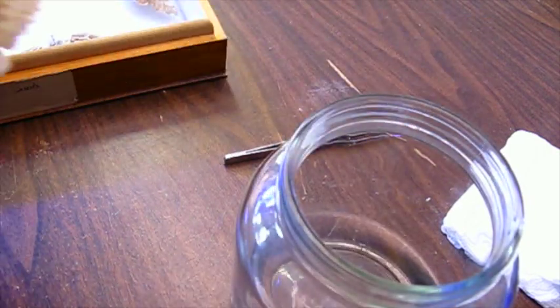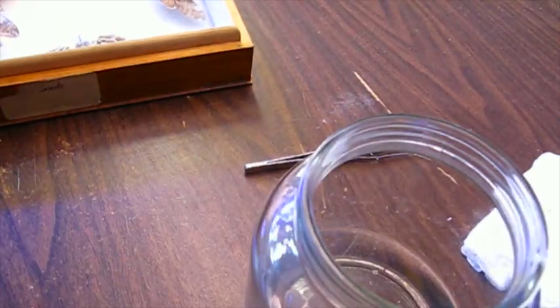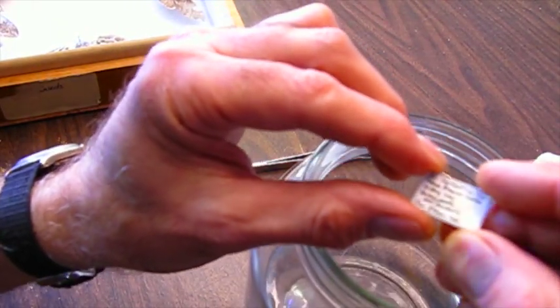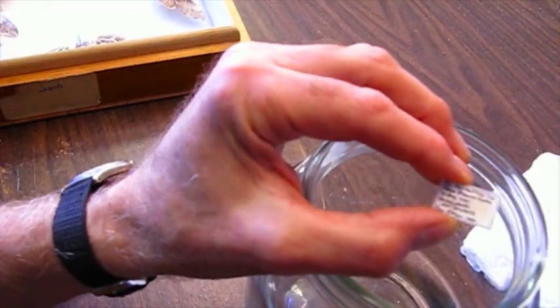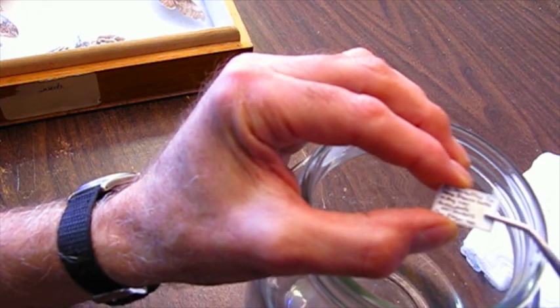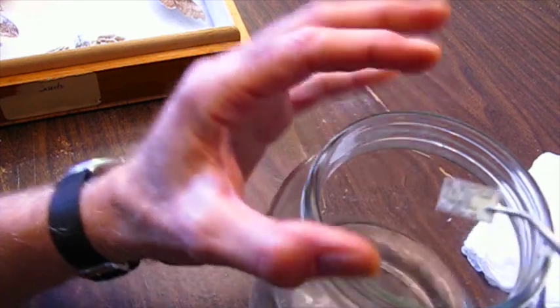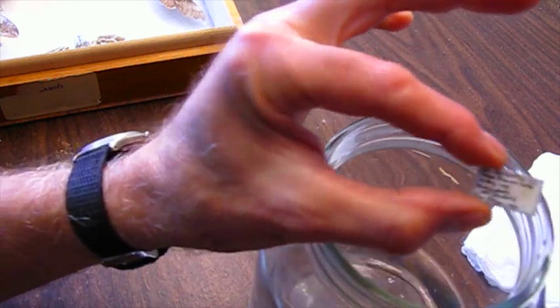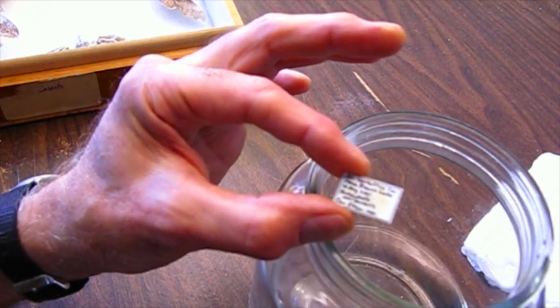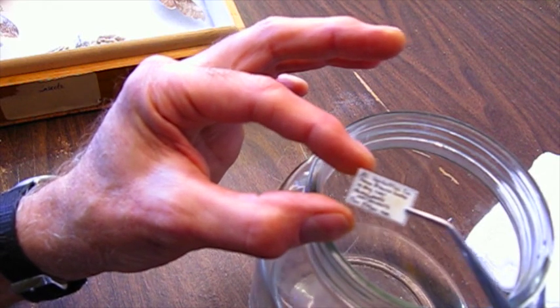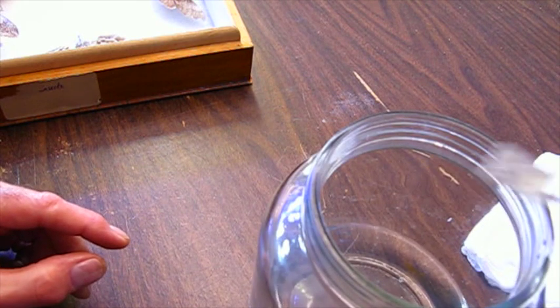I'll pin it next to the other one. This label is actually in pretty good shape, it doesn't have mold growing on it and it's not discolored. But it's been exposed to the mold, so I'll just grab it with the tweezers and dip the label into the acetone in case there's any mold on it. It will sterilize the label. The acetone is really volatile so it will evaporate off really quickly.